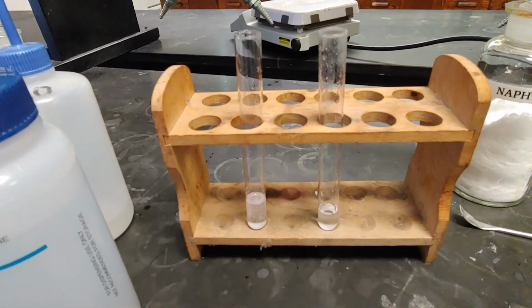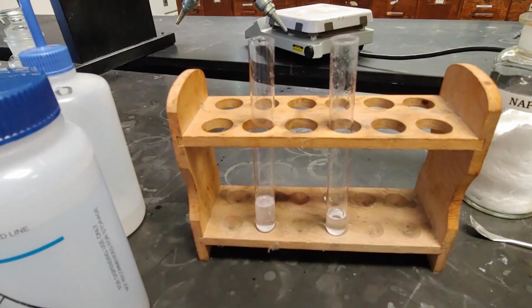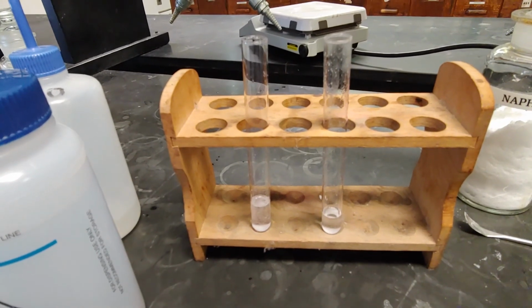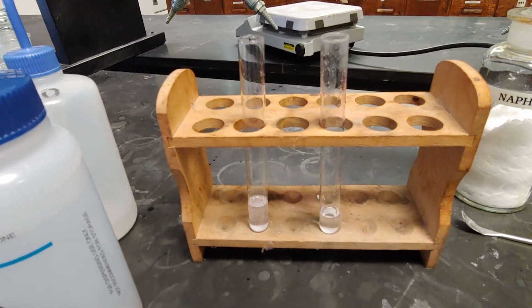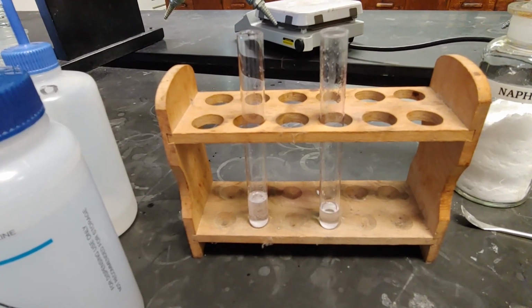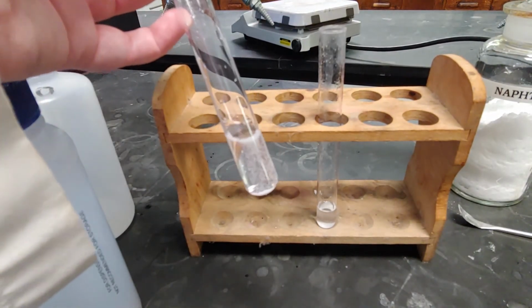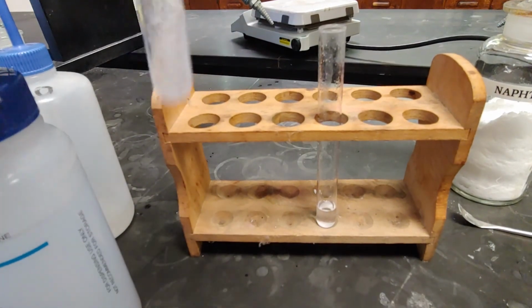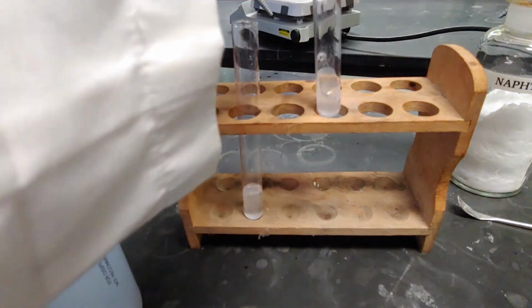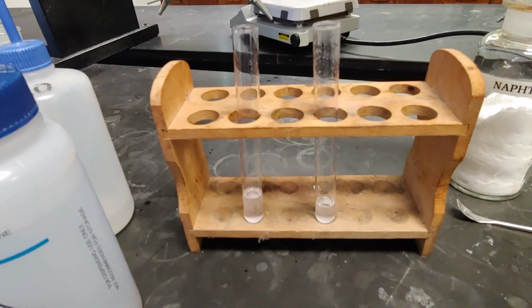Now, what is the point of this experiment, you may ask? Well, besides watching bubbles form, the idea is that since the ground up Alka-Seltzer has more surface area, it dissolves more rapidly and the reaction has much more vigor. You saw clearly how the bubbles went almost to the top of the test tube, whereas the large chunk is still bubbling away. So the more surface area something has, the faster it dissolves. Alright. Well, that is all 4 experiments.